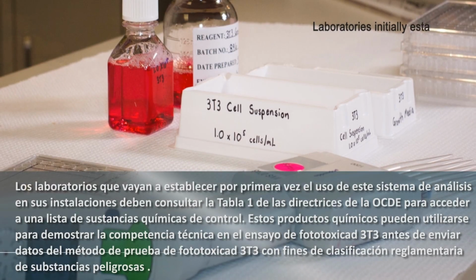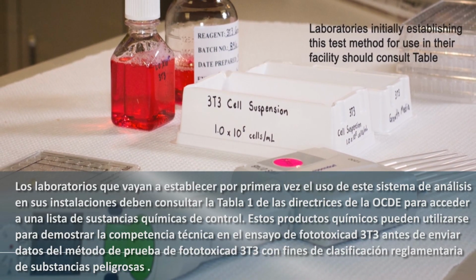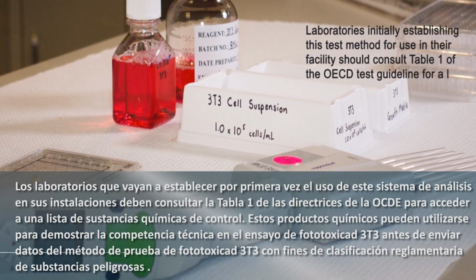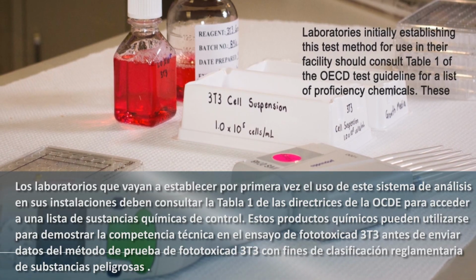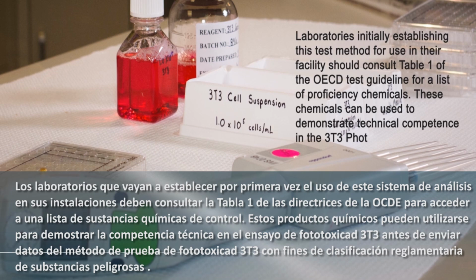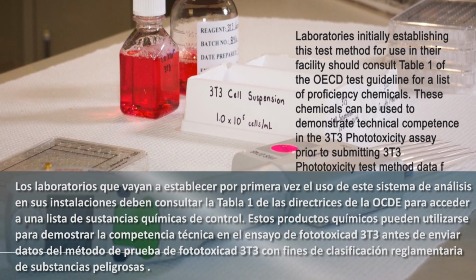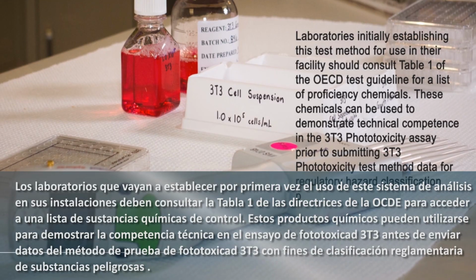Laboratories initially establishing this test method for use in their facility should consult Table 1 of the OECD Test Guideline for a list of proficiency chemicals. These chemicals can be used to demonstrate technical competence in the 3T3 phototoxicity assay prior to submitting 3T3 phototoxicity test method data for regulatory hazard classification purposes.